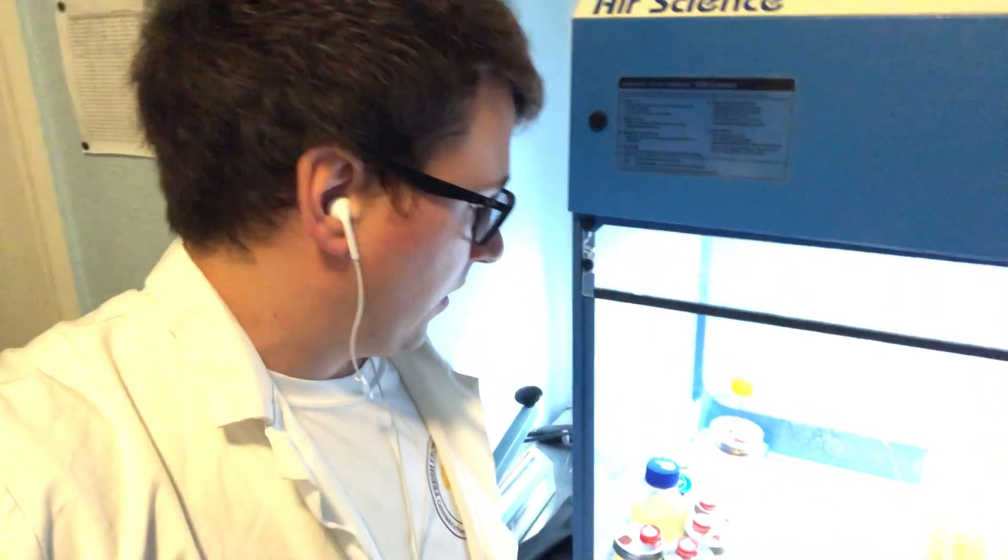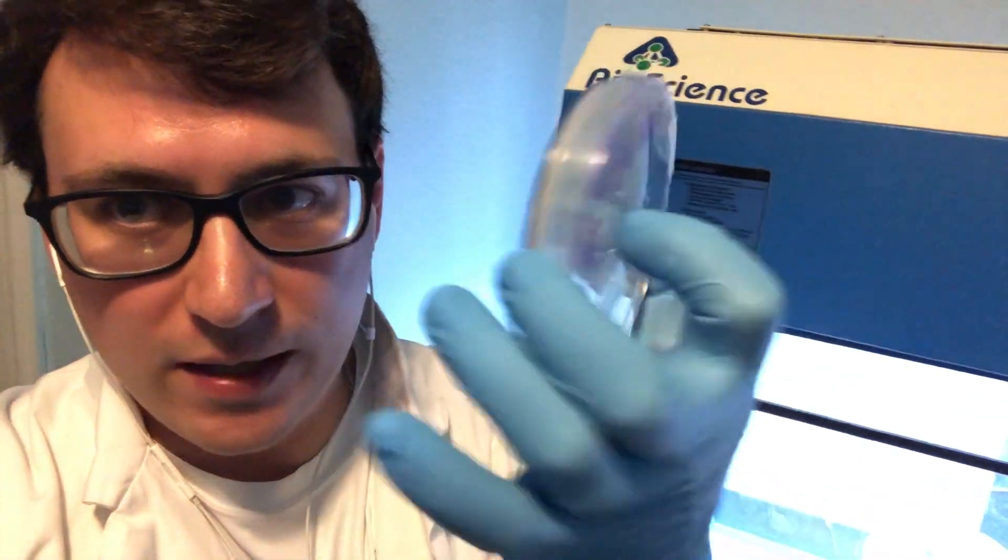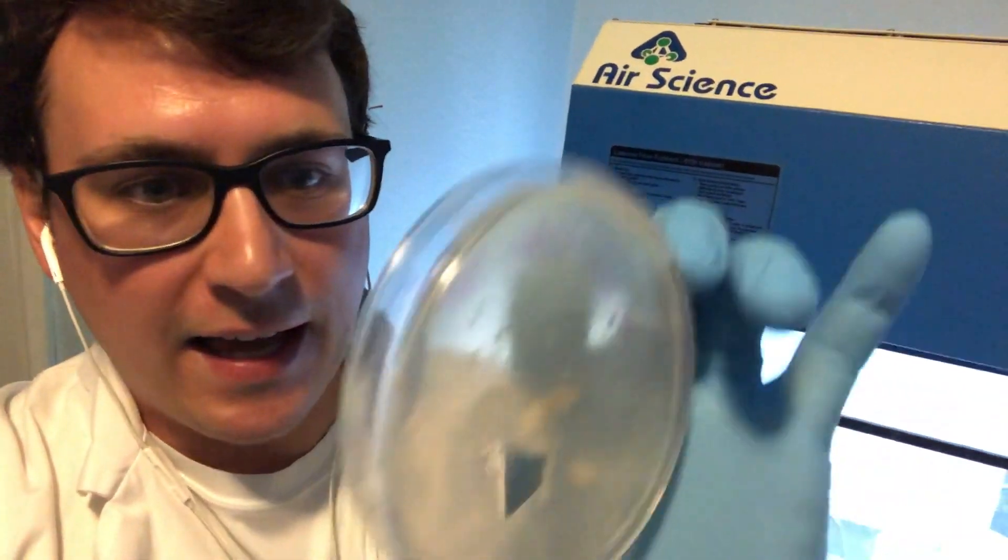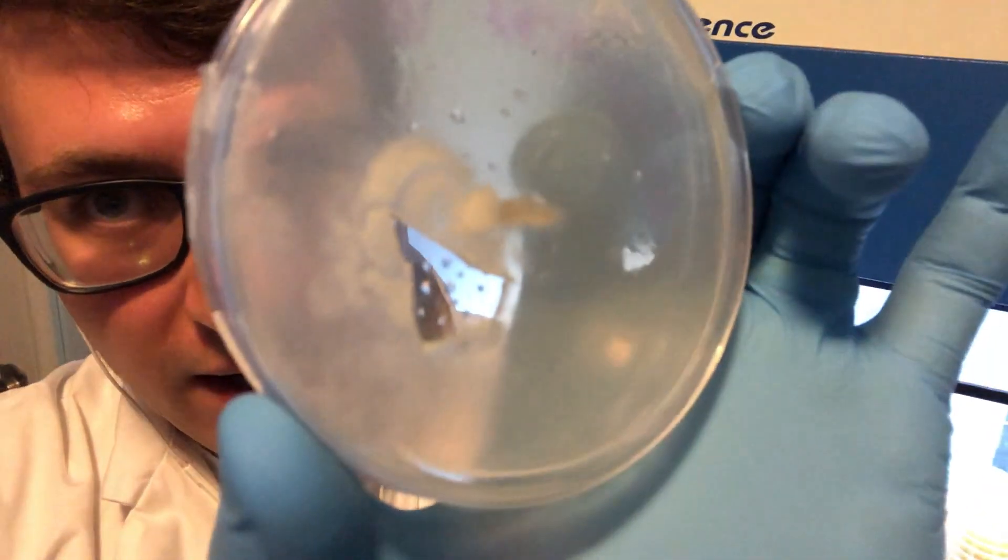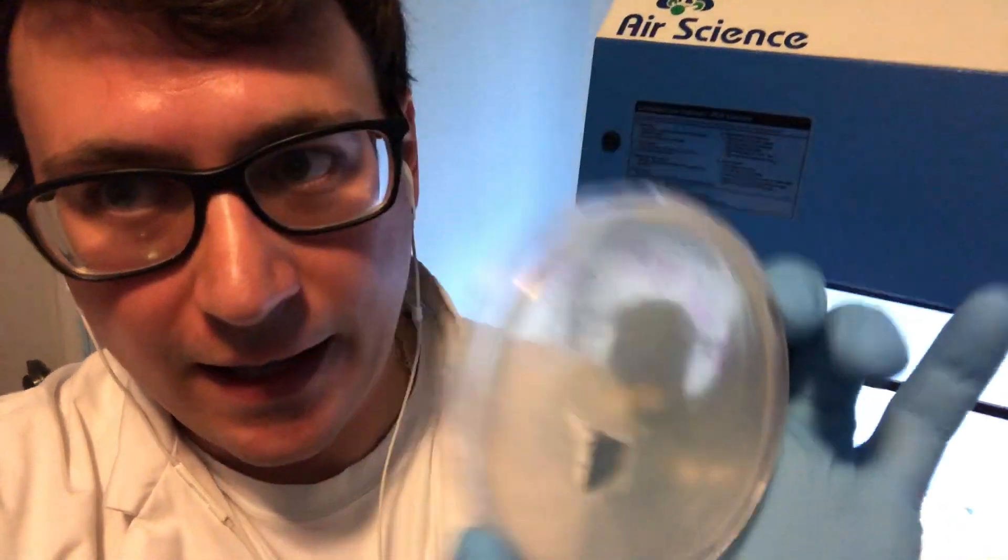So I'm going to be expanding these cultures today, but I thought I'd share with you guys this update. I was blown away when I looked at this plate a few weeks ago, almost two weeks ago, and it had some nice mycelium that was popping out of that tissue. I'm still amazed at the power of fungi.